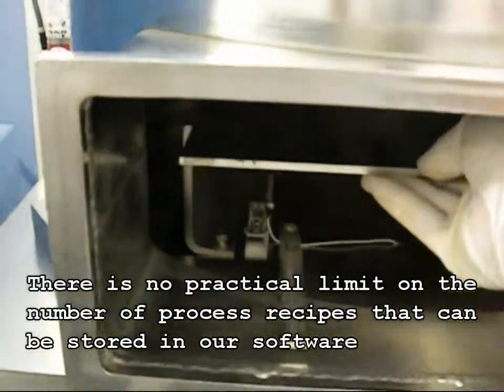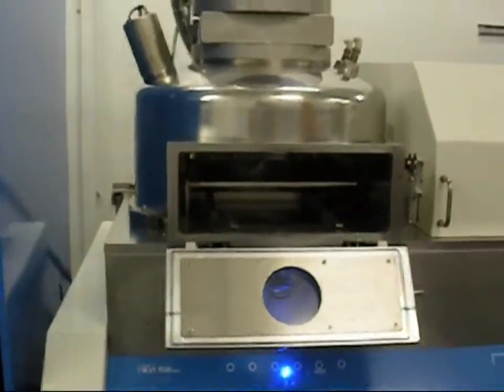The sequence can now be repeated with the same pre-programmed process recipe or a completely different process recipe.